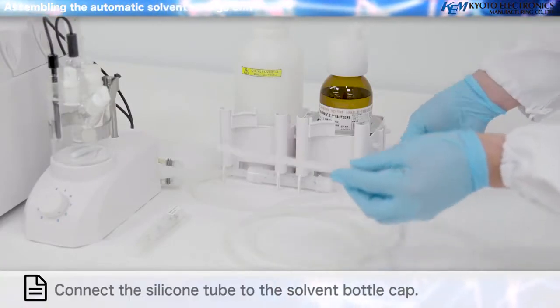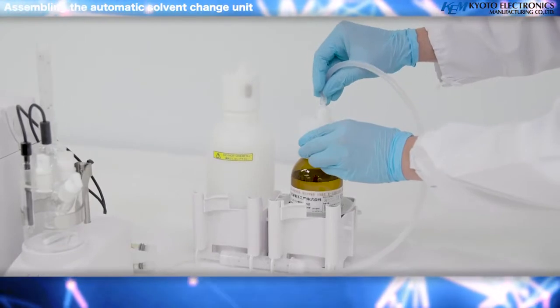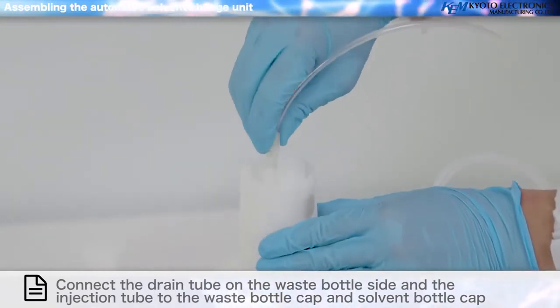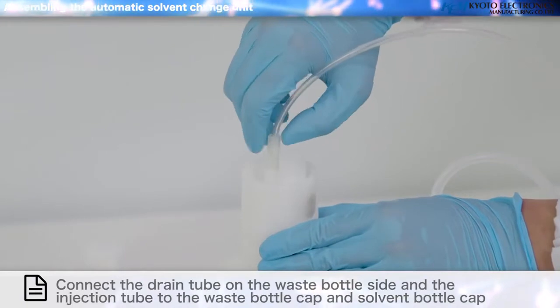Connect the silicone tube to the solvent bottle cap. Connect the drain tube on the waste bottle side and the injection tube to the waste bottle cap and solvent bottle cap respectively.